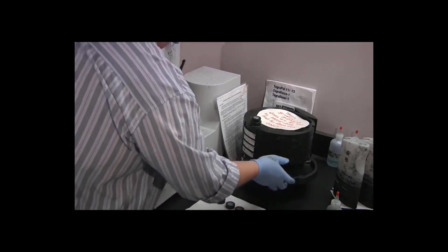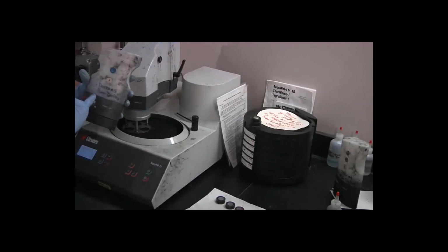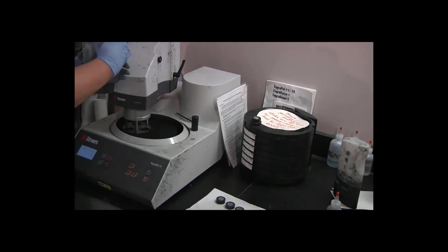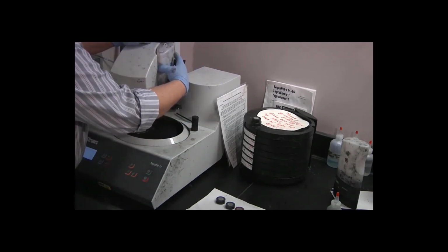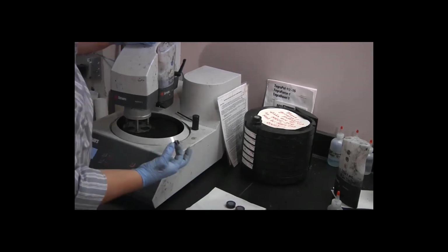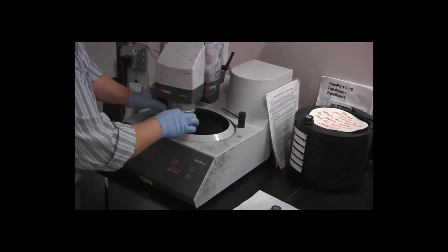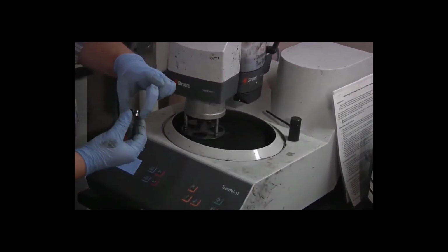Lower the mover head, and now I want to take the second doser bottle, ID number 5, containing 3 micron diamond particles. Again, swing the bottom out, place the bottle up against the side, straight down to latch it in place, bring the bottom of the bottle back to flush with the top. Put my specimens back on in place. Again, be very careful at this stage not to touch the metal.